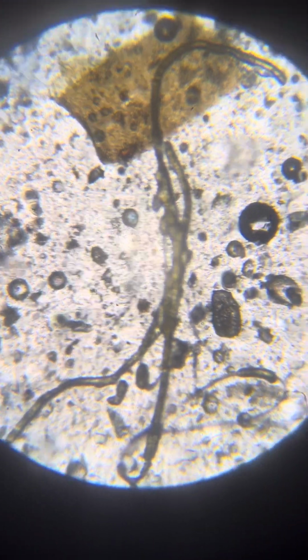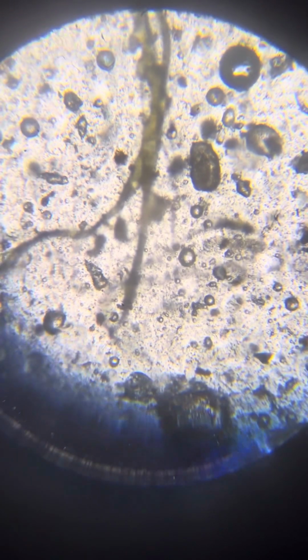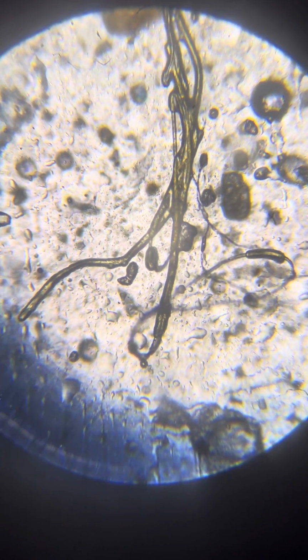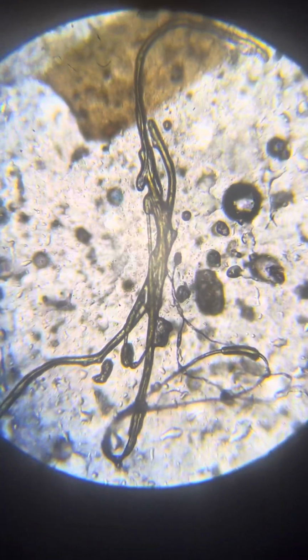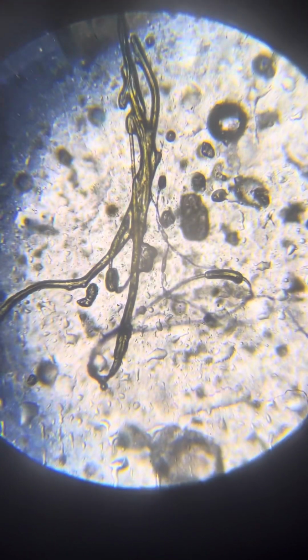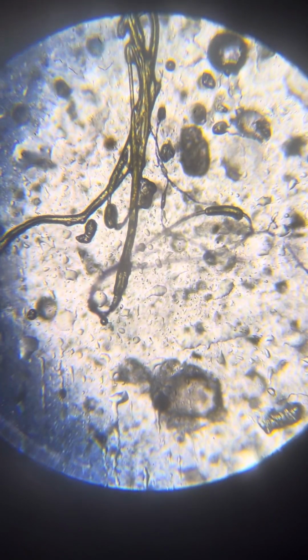So, we should also suggest what actually happens here, because what we see here is in line with what I thought about yesterday and this morning. So here we see a very complicated life form. You see the sausage, like here, of the sausage type.